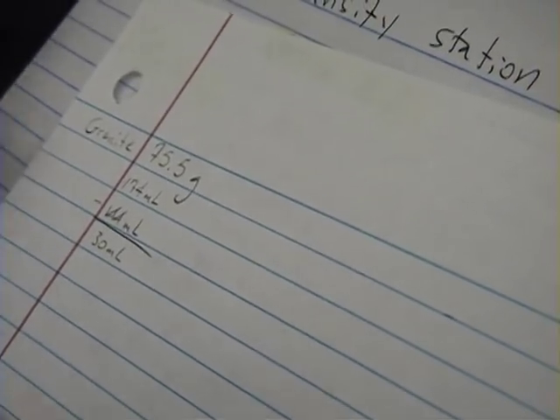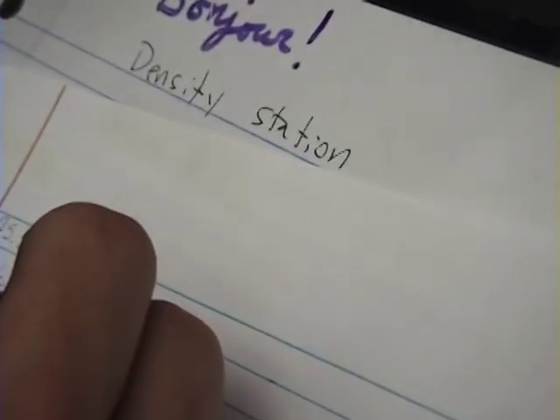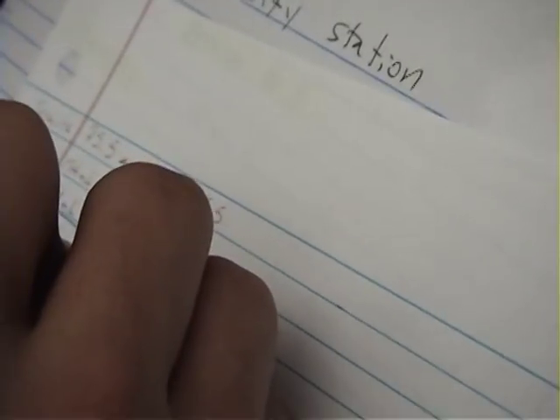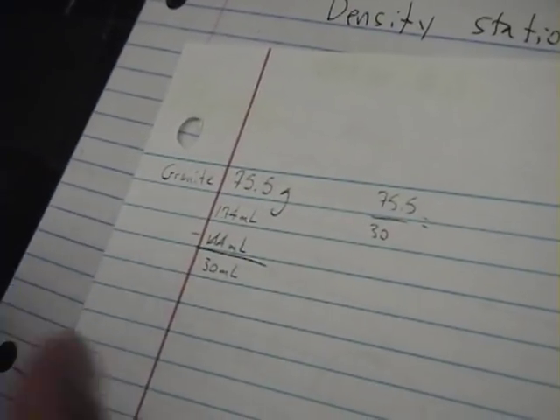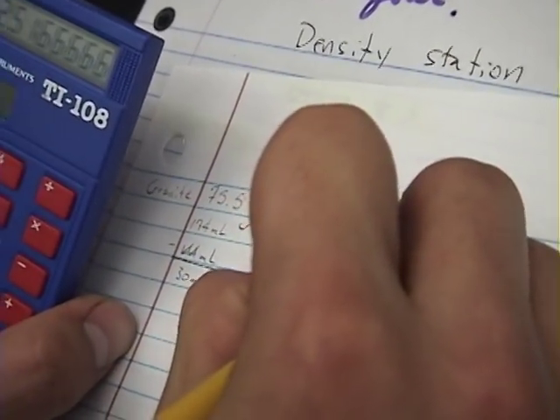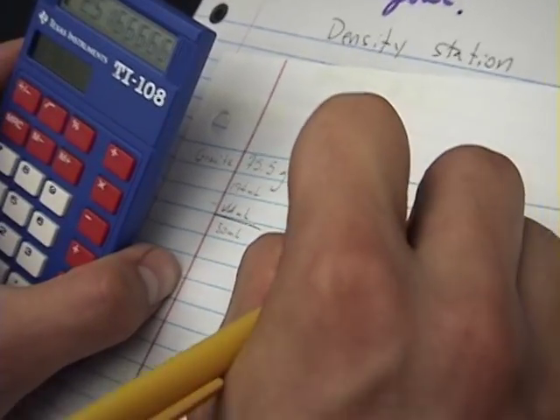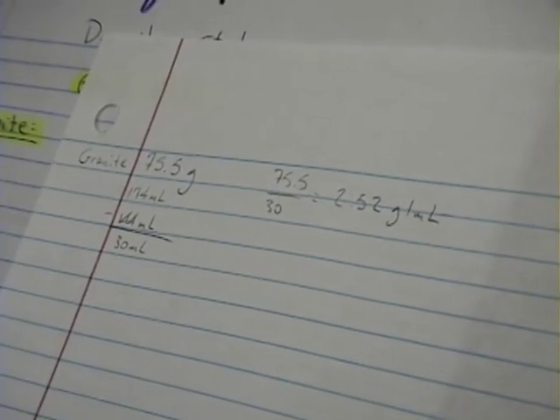So now you take the seventy-five point five divided by thirty, which will give you two point five two grams per milliliter. So that's the density of granite. And if you really want to make sure that your measurements are accurate and precise, you could do those measurements two or three more times and then take the average.